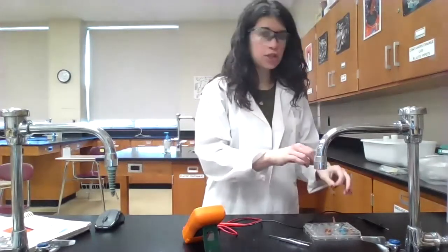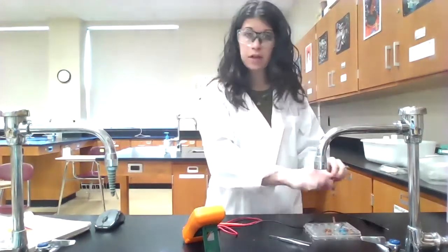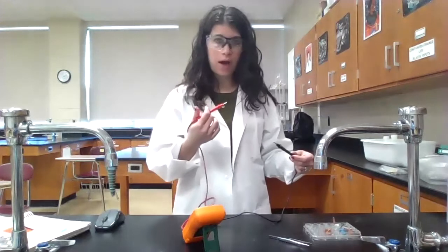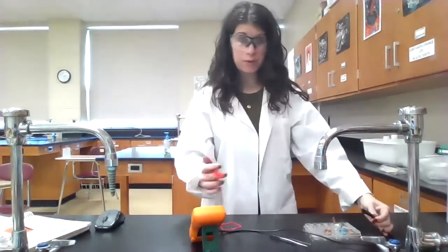So once I've done that, what I did now was I took that 0.001 molar copper(II) nitrate solution and I put it in a well next to the 1 molar zinc nitrate solution. I added a fresh salt bridge that was dipped in potassium nitrate, and then I added my strips of zinc and copper metal. I'm still going to keep zinc as the anode, so I'm going to connect the black wire to the zinc and the red wire to the copper. And then I'm going to record the voltage.